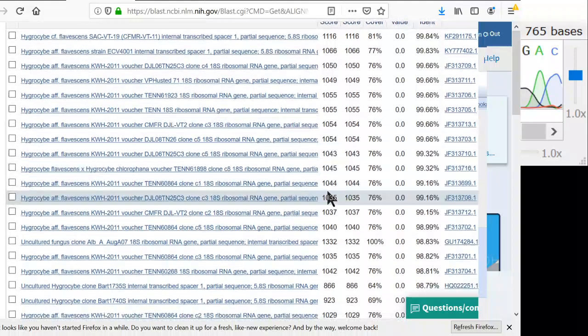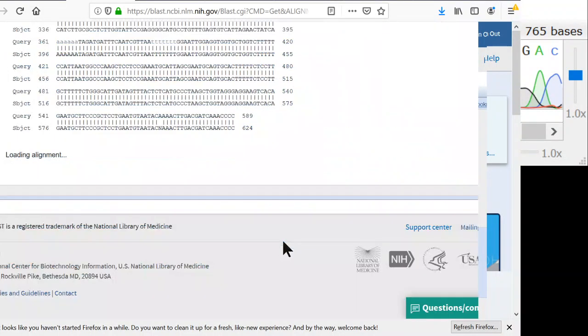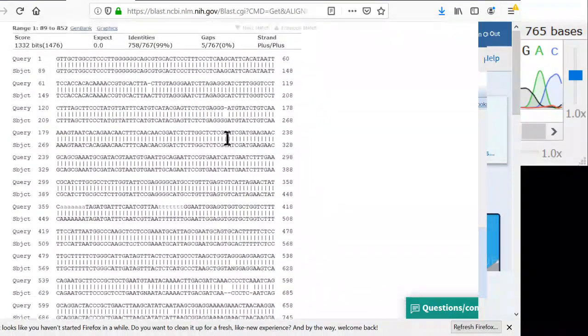But I think we want one where the query coverage is 100%, and so the first one where the query coverage is 100% but has really good ident is this one here. And this is uncultured fungus clone, which means that they just sequenced a whole bunch of soil, and their soil had Hygrocybe DNA in there. So we'll click on that, and we can see the differences down here.